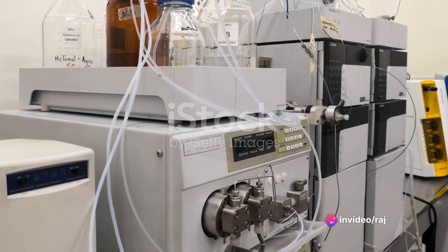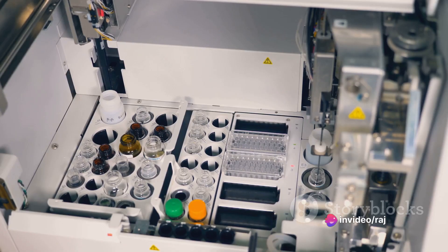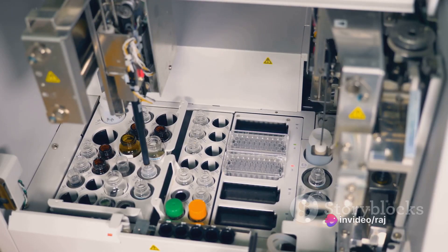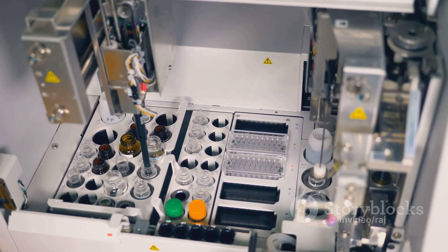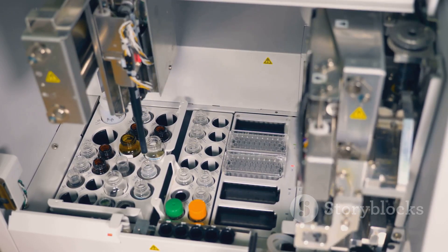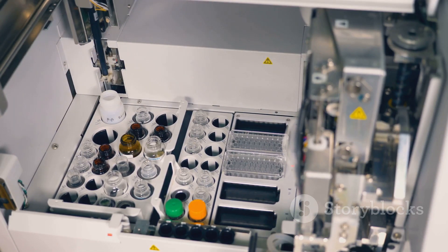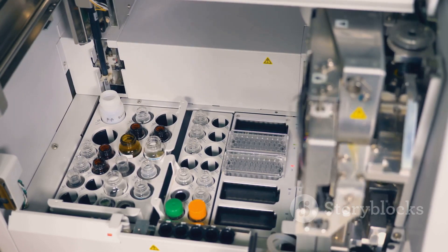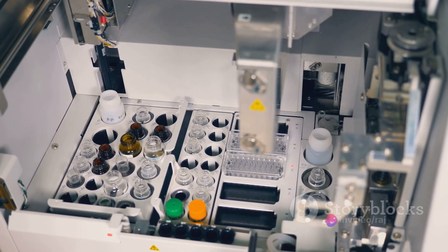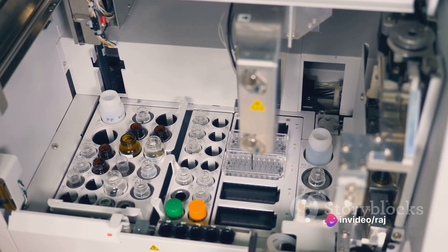Next, the mobile phase is introduced into the HPLC system, where it will travel through a column packed with a specially designed stationary phase. This stationary phase is the true hero of our story, as it is carefully crafted to interact differently with each of our chiral compounds.